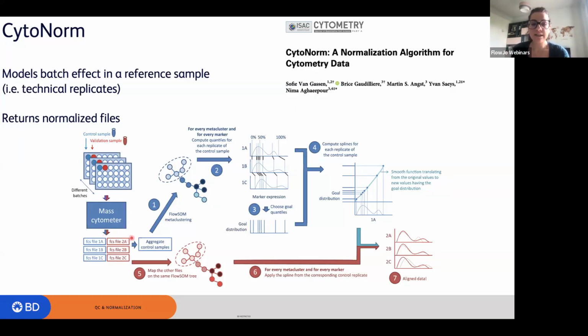So it takes the control files, creates an aggregate control sample, and then runs a clustering algorithm on that, so basically a FlowSOM metaclustering algorithm. And then for every metacluster and for every marker, it computes the quantiles for each replicate of the control sample. So here you see the marker expression, and here are the quantiles. And then it chooses the goal quantile, so basically the distribution, and computes splines for each replicate of the control sample. So the goal is to have a smooth function translating from the original values to the new values that have the goal distribution. And then it goes to the actual sample and maps the other files on the same FlowSOM tree, as you can see here.